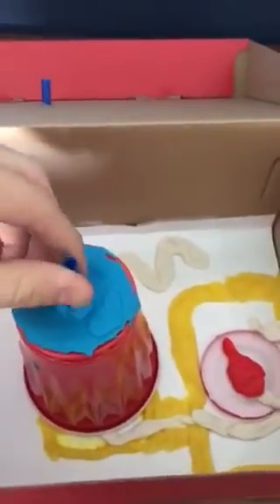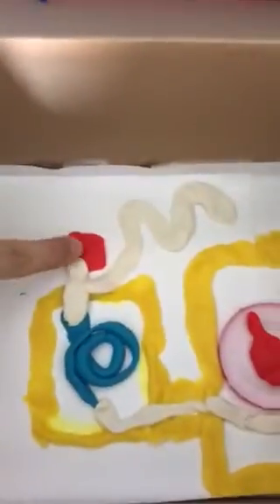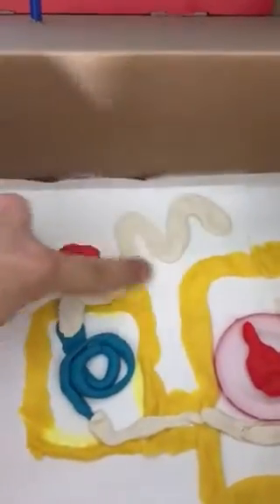So what we have here is my GC. We have our injection port right here, along with our gas coming in to help push our analyte into the column. If we look here, we have our oven, and if we look at a 2D model of our oven, we have our injection port in red, and then the gas coming into our injection.